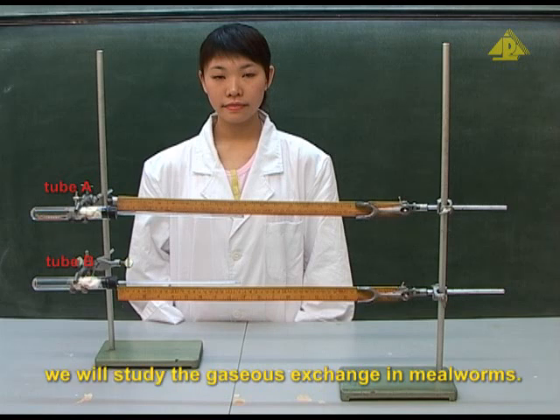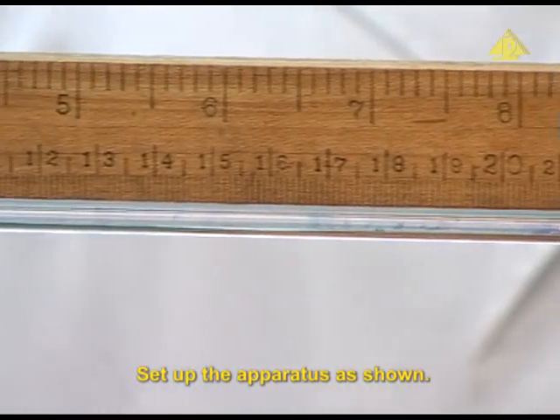In this experiment, we will study the gaseous exchange in mealworms. Set up the apparatus as shown.